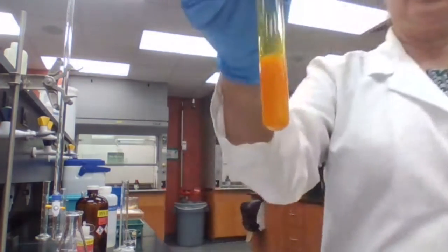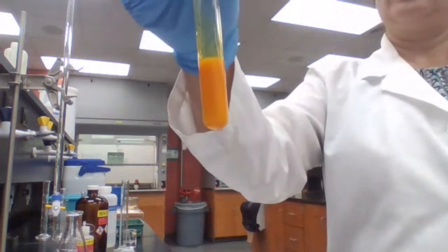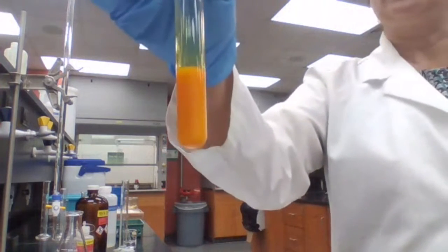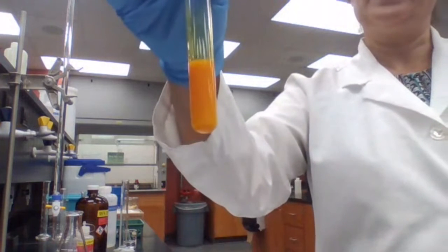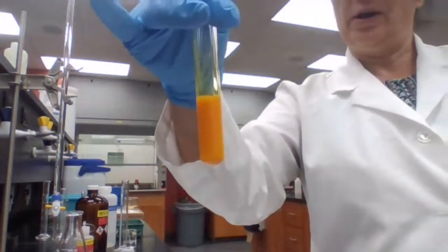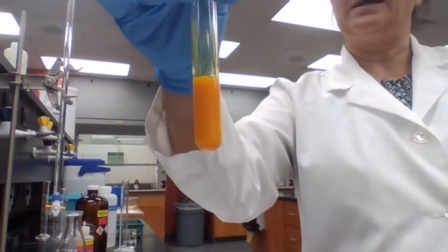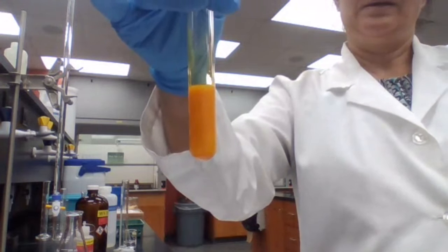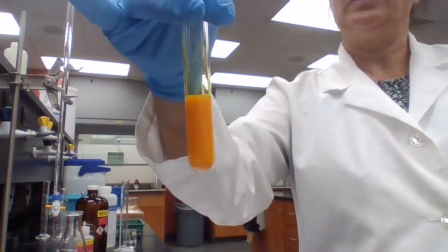This is the test for dinitrophenylhydrazine and your unknown. I do not need the screenshots to be turned in. All you need to do is record your observation so you could identify your unknown. Did you all see the test tube with the result of DNP 2,4-dinitro?